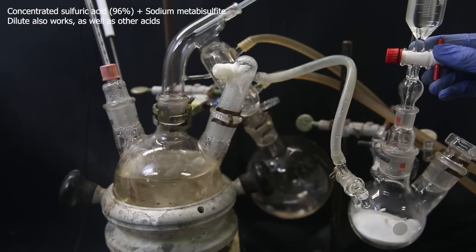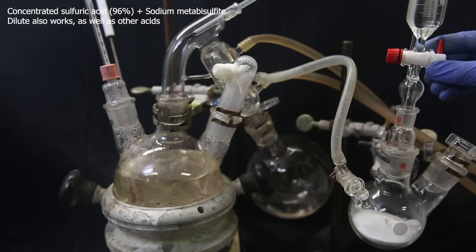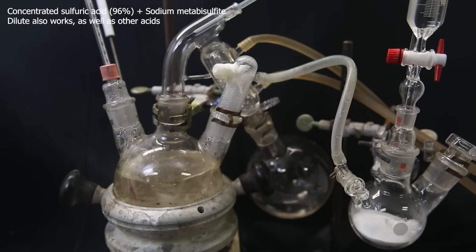Just make sure that the sulfur dioxide is bubbled through the liquid. Almost immediately after a tiny bit of sulfur dioxide was added, the mixture became transparent, because all the paraformaldehyde quickly converted to formaldehyde. When that happens, it also immediately starts to react, and a mixture of the product and water starts distilling over.